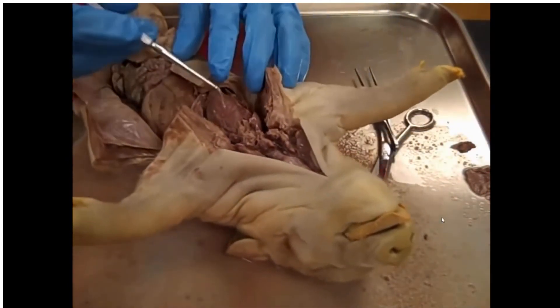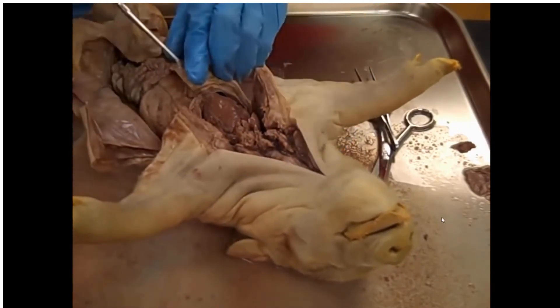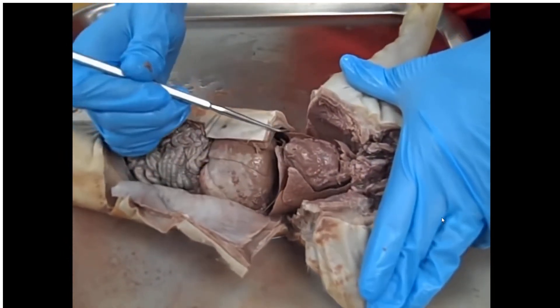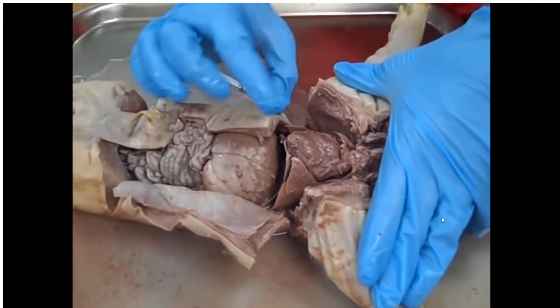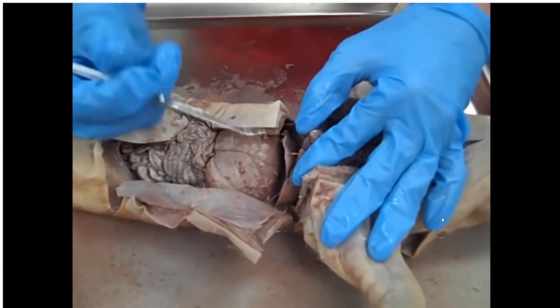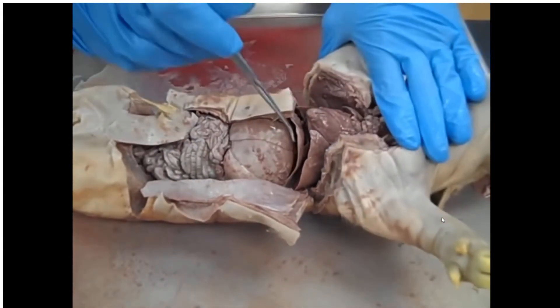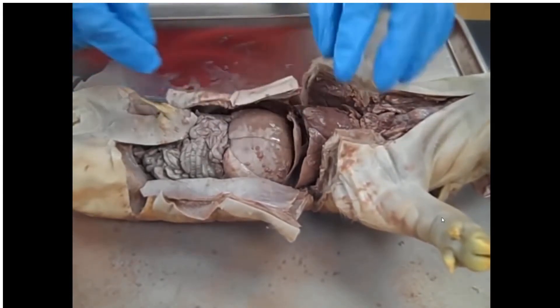Moving on down into the thoracic cavity — obviously, this right here is the heart. You can see it's an enlarged muscular organ. The left ventricle would be running all the way down to the apex, or the tip, of the heart. On either side of the heart you can notice these fleshy lobes — very delicate, very lightweight and squishy if you were to feel them with your gloved hand. Those are the different lobes of the lung. Up underneath that we have this flap right here — this is the remnant of our diaphragm. I've had to cut it all the way around so that we could open up the thoracic and abdominal cavities, but you can still see the remnant of the diaphragm right there.